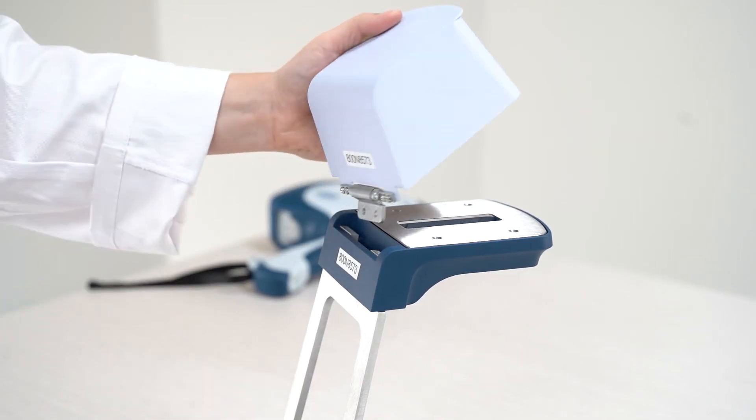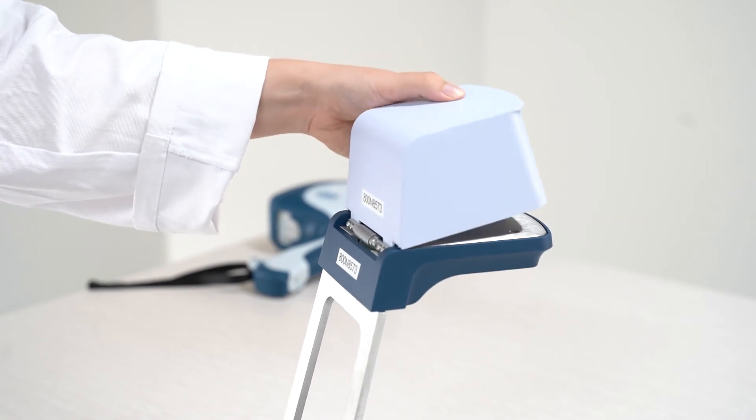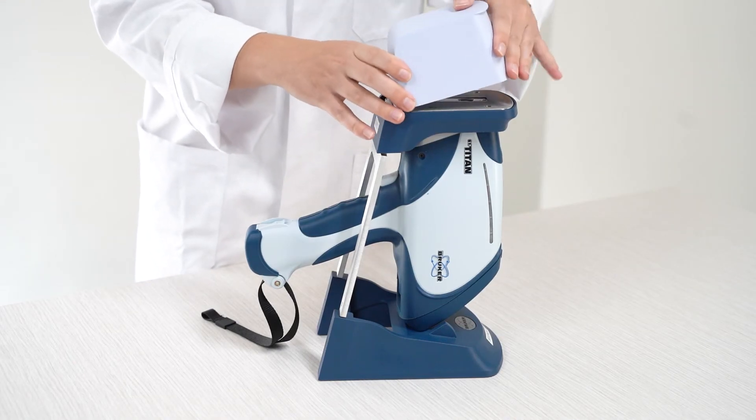The lid has a metal hinge that needs to point down to slot into the stand. Once the lid is on, it is ready to use.